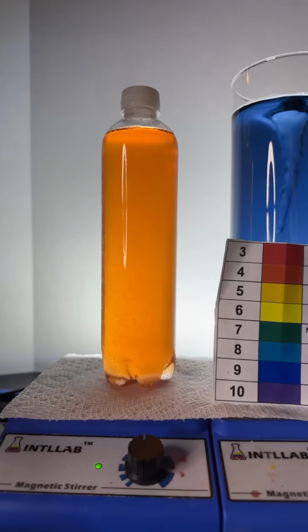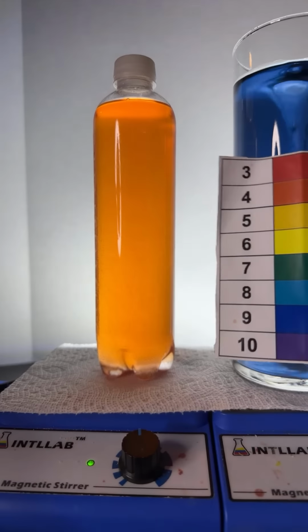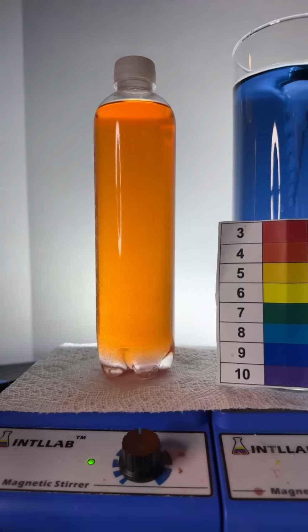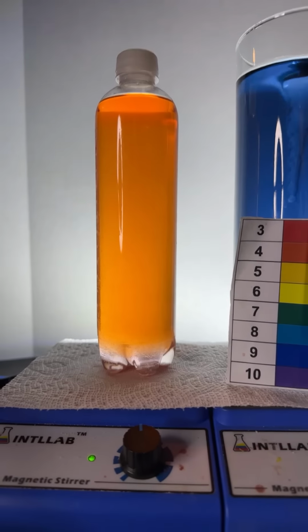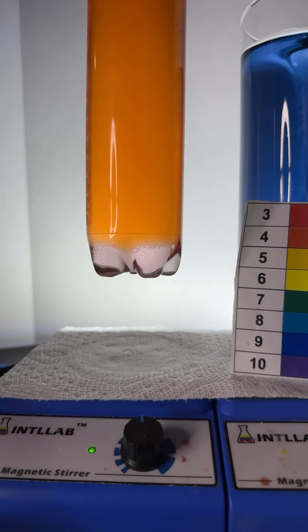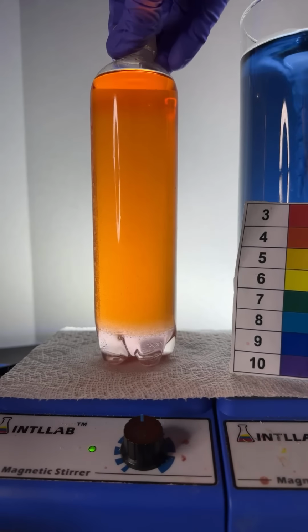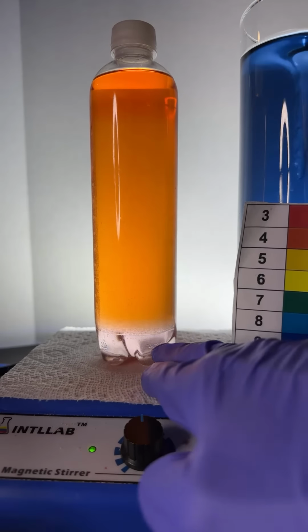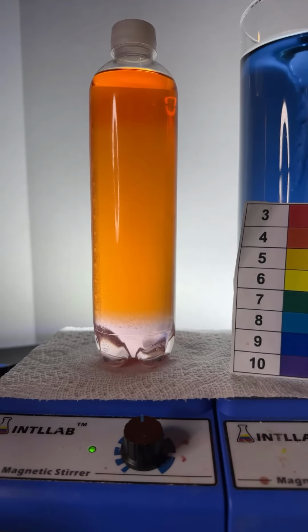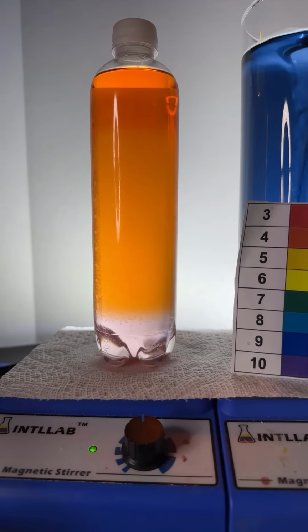So it looks like we got a color shift, right? I added some acid, and we went from like a pH of 6 down to a pH of 5 or 4, so it's getting more acidic. And we're still getting the color separation. But look, as we're lowering the pH, the dyes do not dissolve quite as well in that saltwater layer anymore. Could I add some baking soda? Unfortunately, Trey, I don't have any.